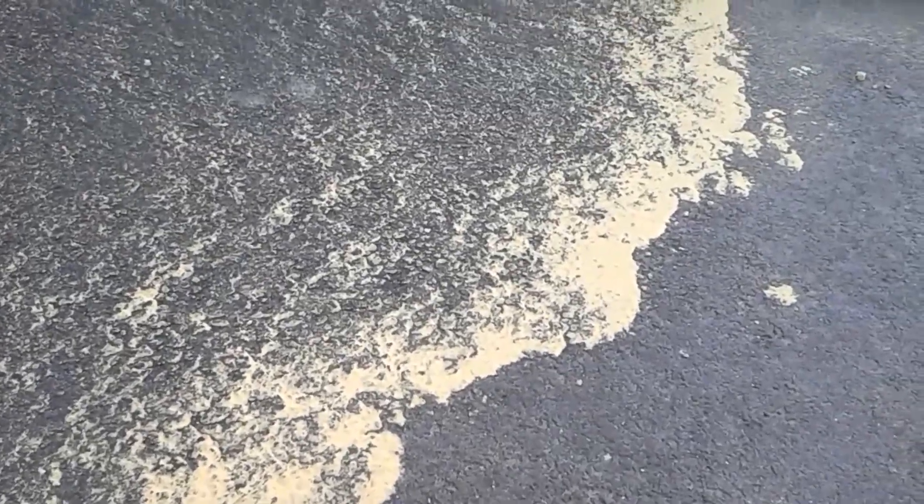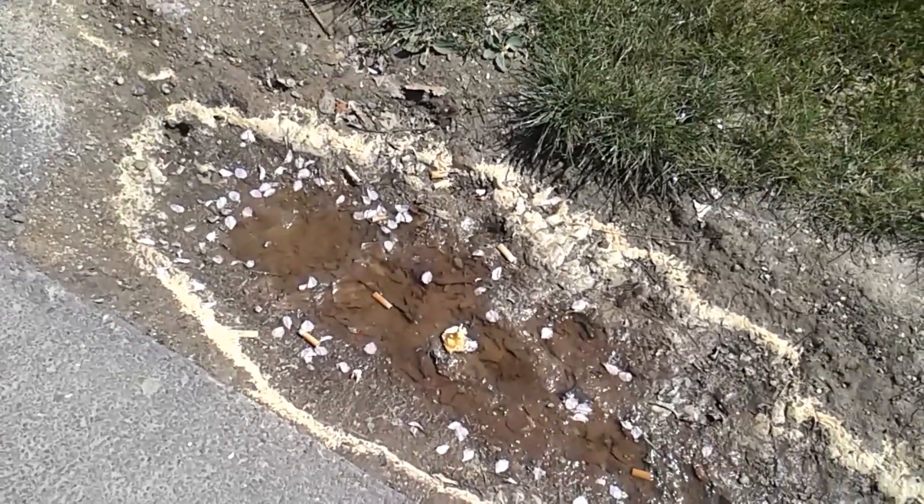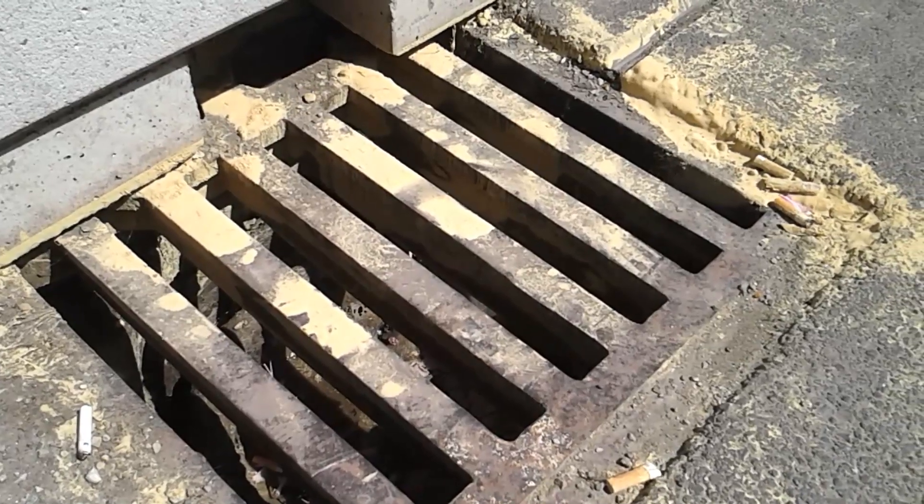On the pavement I found a lot of this yellow stuff that's been washed off by the rain. I think these might be pollen. I'll collect a sample and have a close look at it under the microscope.